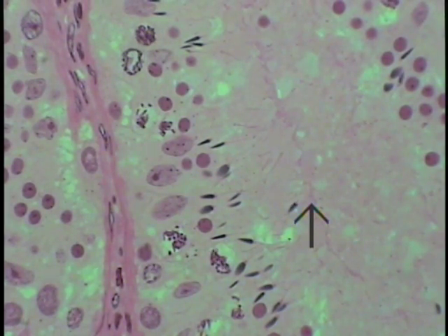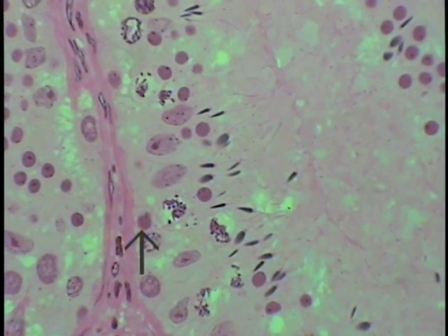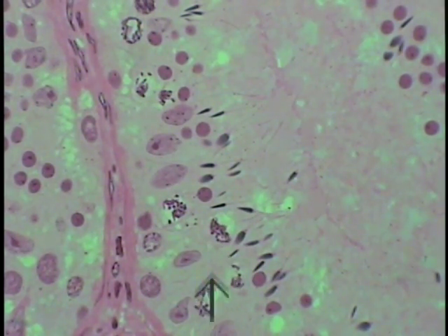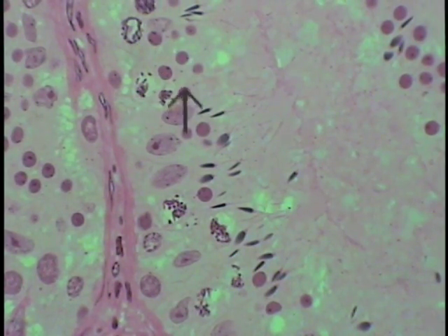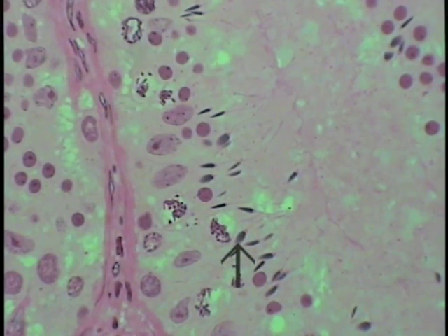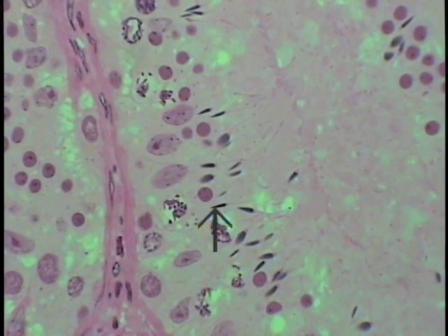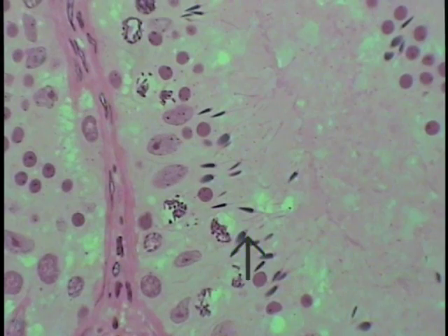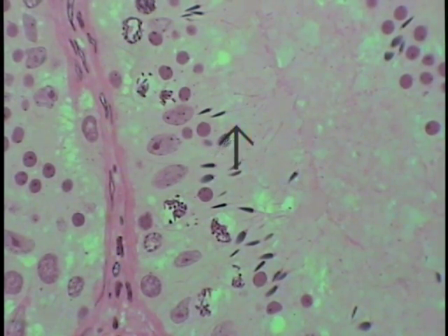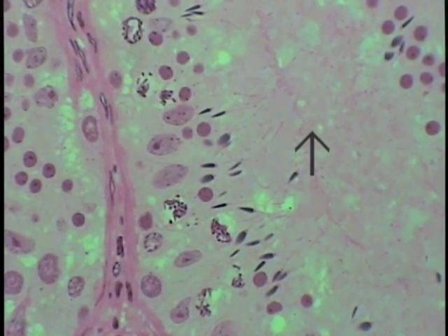Other cell types visible in this preparation include spermatogonia, primary spermatocytes, early spermatids, and late spermatids. One spermatid is shown flat-on and another at a different angle. Even the beginning of the middle piece can be made out in these near-mature spermatozoa, with tails visible — it would not be long before they were transported and released by the Sertoli cell.